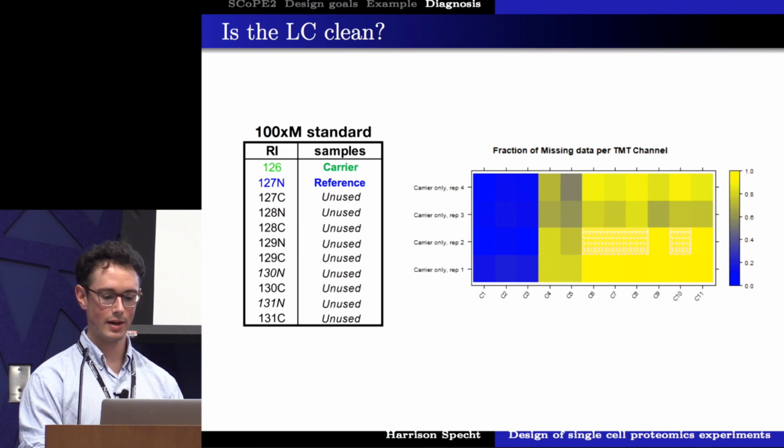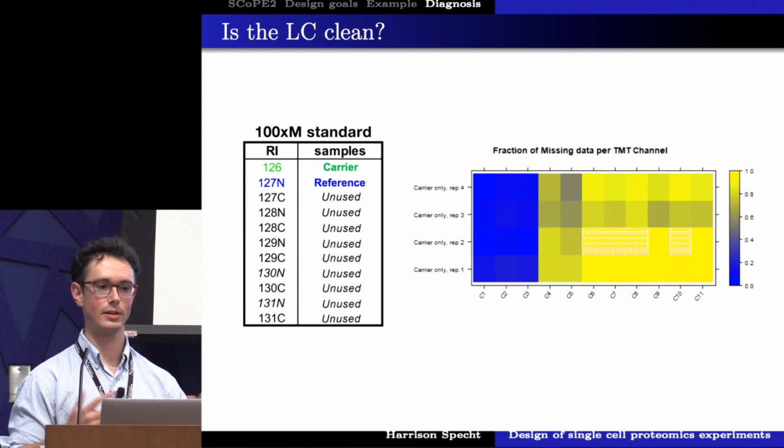But we can see, I show 4 replicates here of our carrier-only sample. We can see that we have a high fraction of missing values in our single cell channels here in the same order as over here. And then we have some samples where we had some signal in the background, and we needed to run more blanks and clean our system better to assure that we had accurate single cell capabilities.